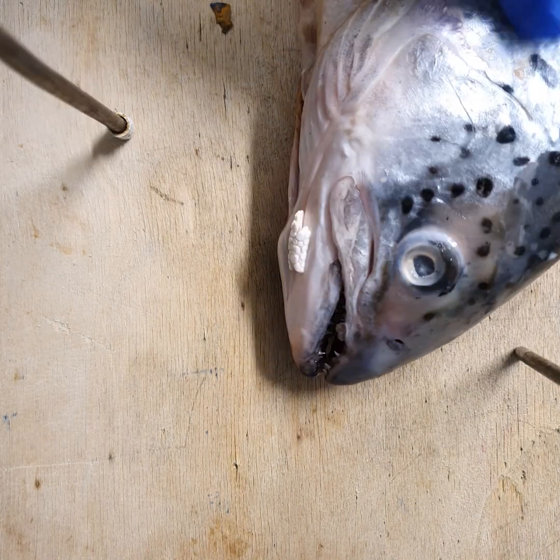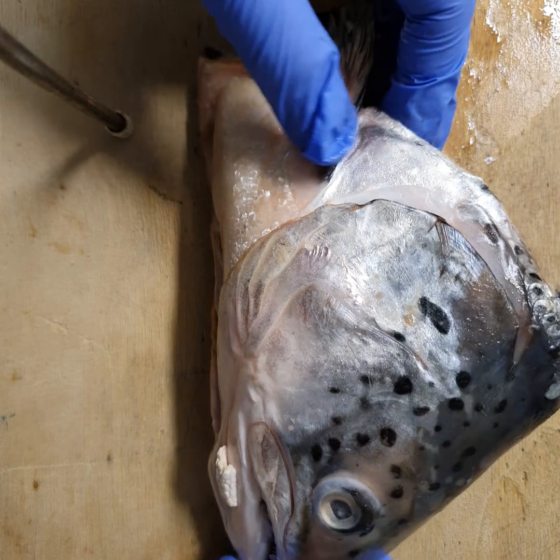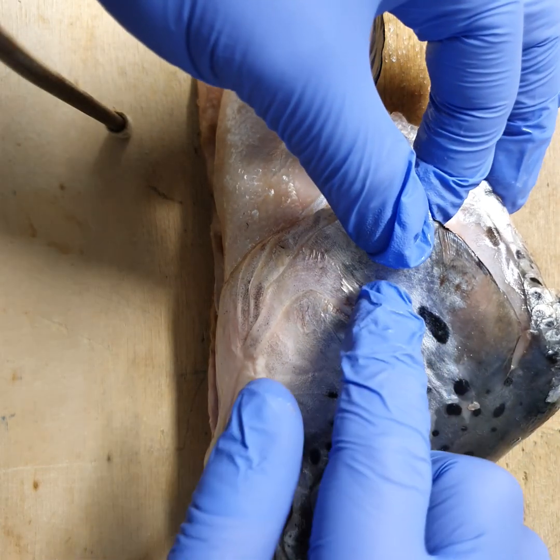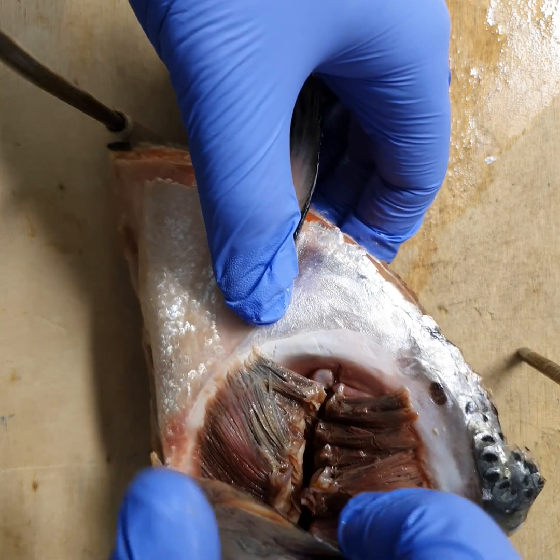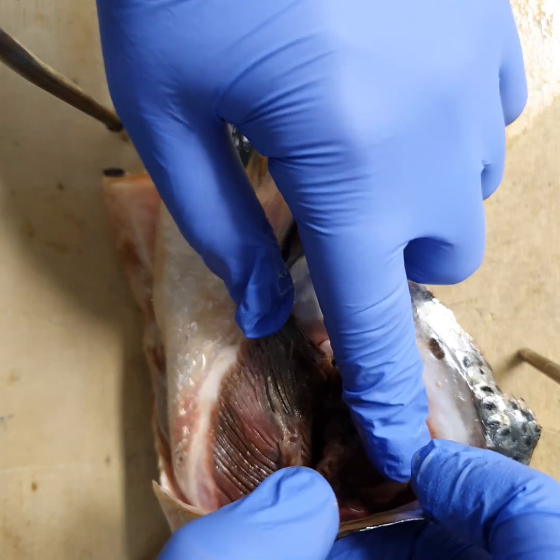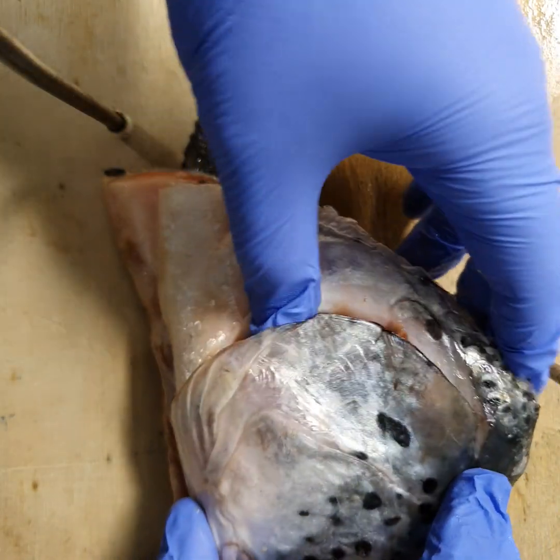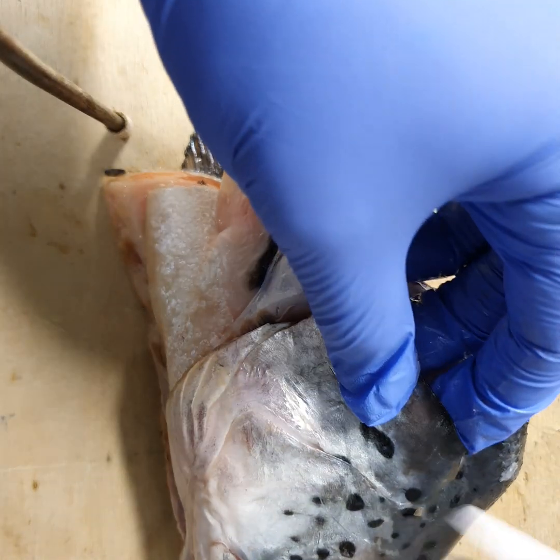As promised, I'm going to show you today a gill dissection of a salmon. This is a salmon head — a salmon is an example of a bony fish. What I've got here is a hard bony flap called the operculum. If you open up the operculum, as I'm about to do, you expose the gills or the gill cavity. The visible structures here are filaments, and the filaments protrude from the bony gill arches. The first thing we do when we dissect is cut open the operculum.